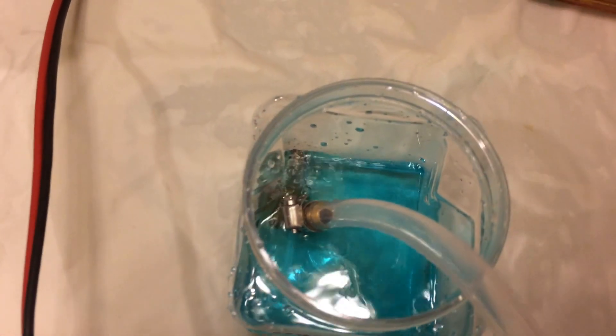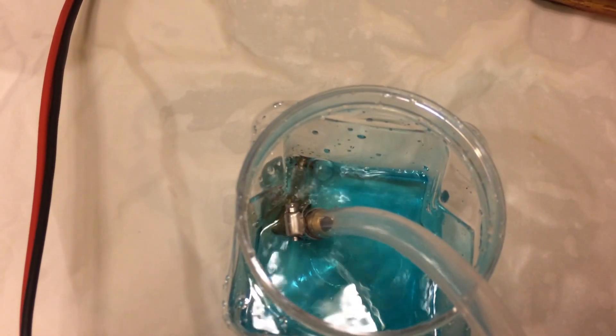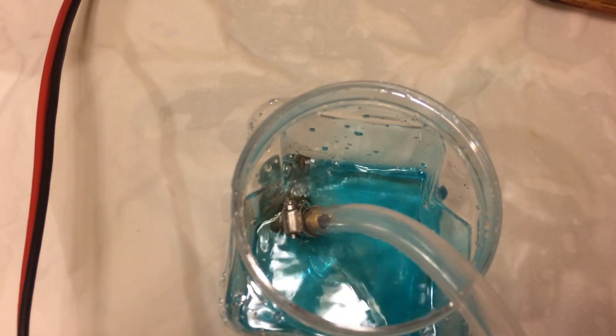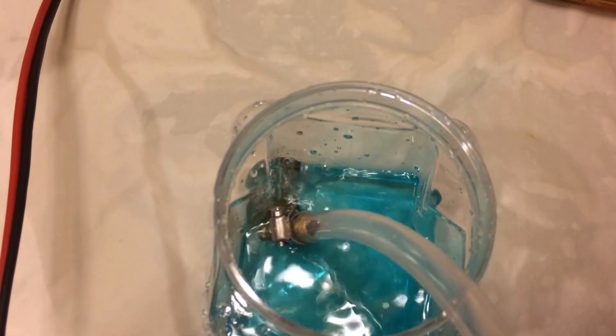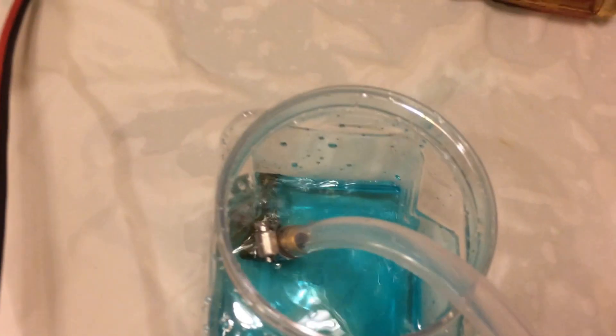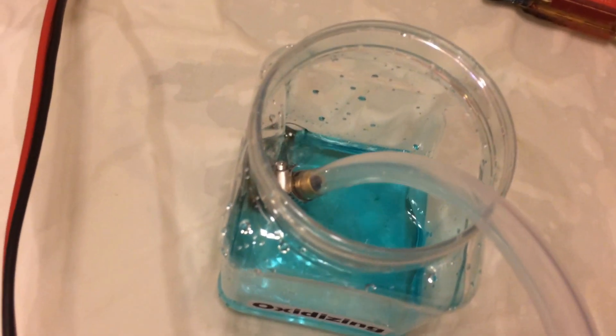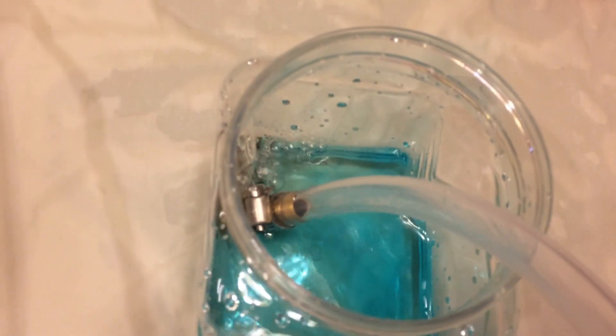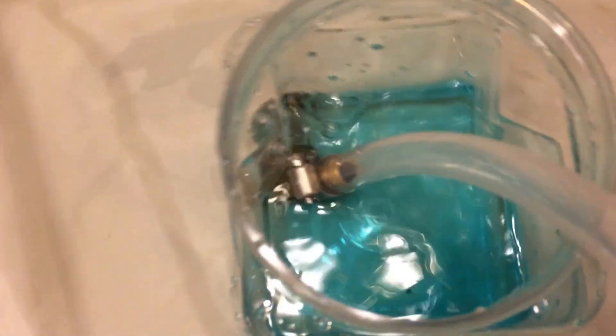Current's coming up. That side there is hot. The other one's not? No. That means it's not got a good connection there. I can't tighten it down because it's hitting. No, it's not hitting.